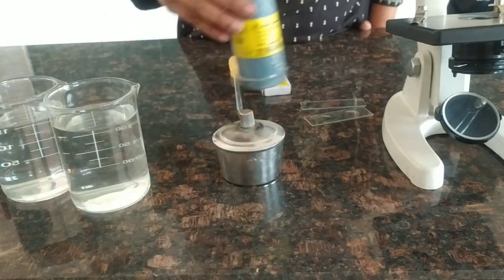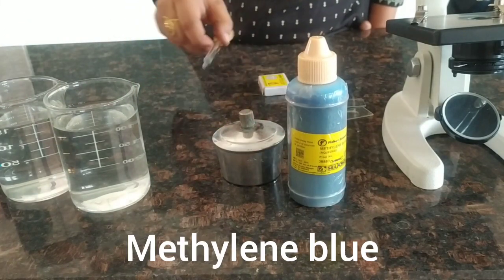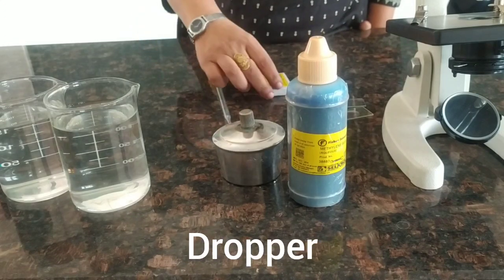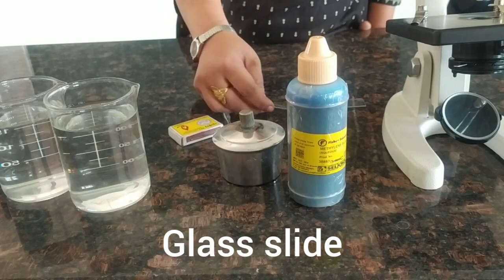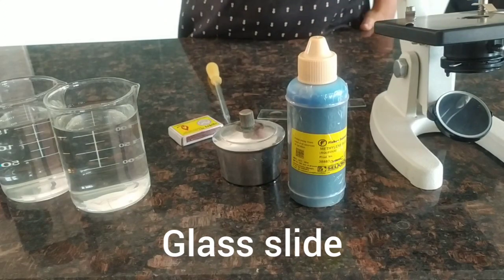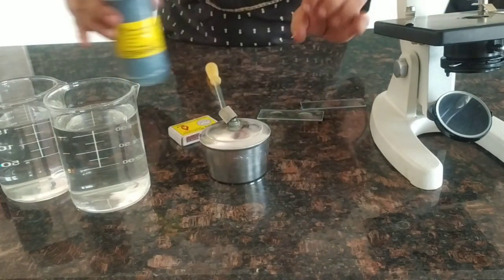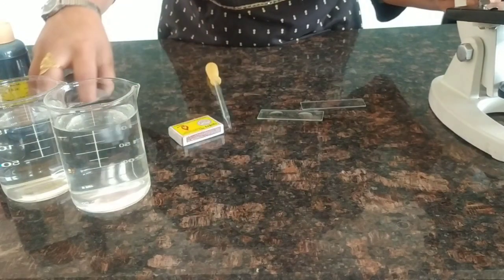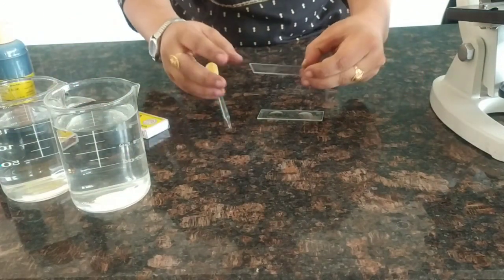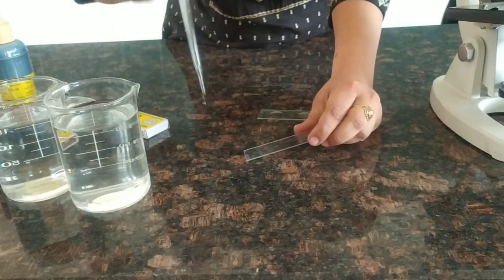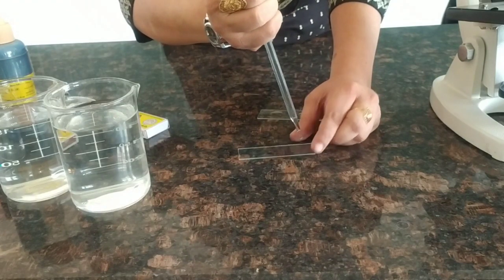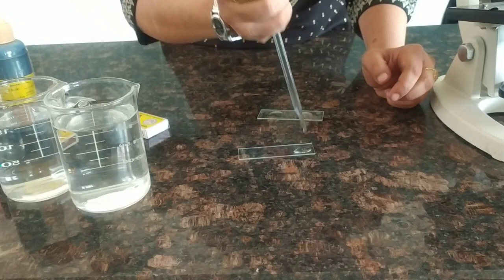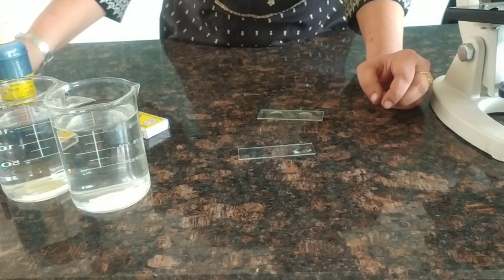Spirit lamp, methylene blue, dropper, matchbox, slides. The first step of the experiment is take a clean slide which is dust free. With the help of a dropper, take two to three drops of water on the slide.